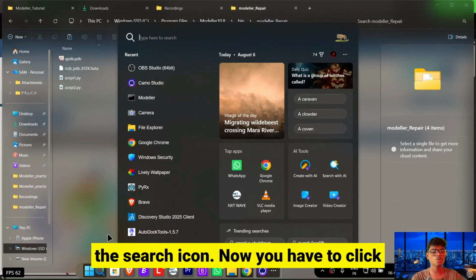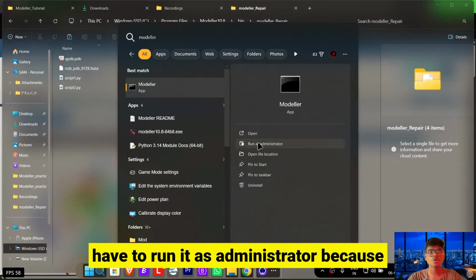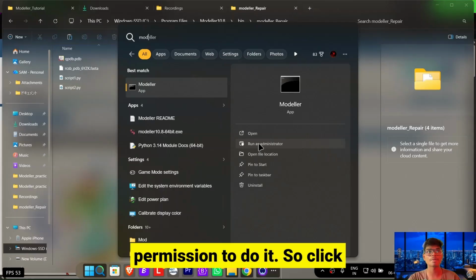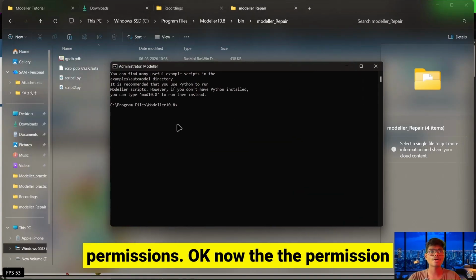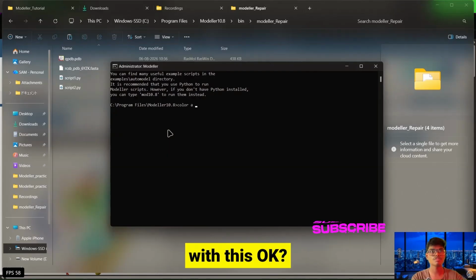Now we are going to launch the modeller application using the search icon. Click here and type modeller. After that you have to run it as administrator, because the C drive needs administrator permission. So click here and give the permissions. Okay, now the permission has been granted. Now let's start with the icon.